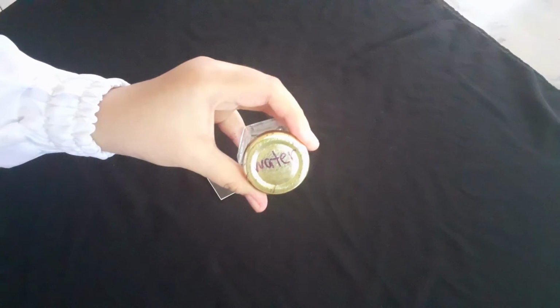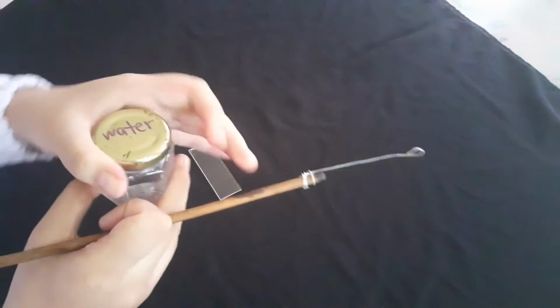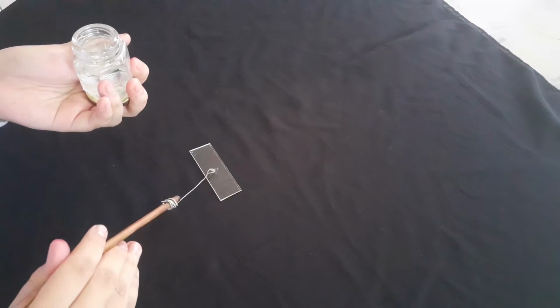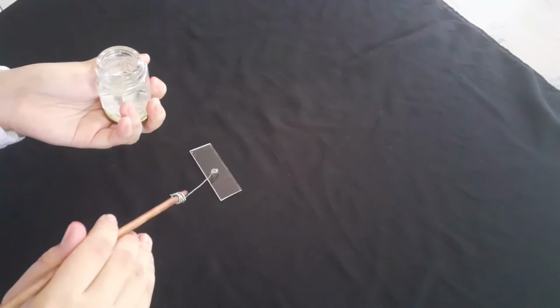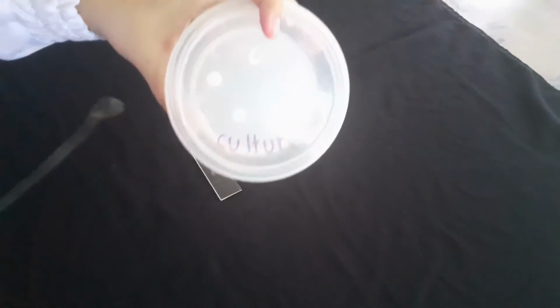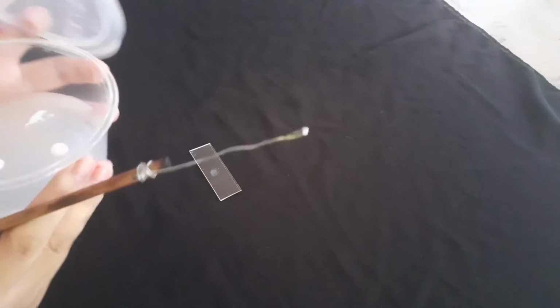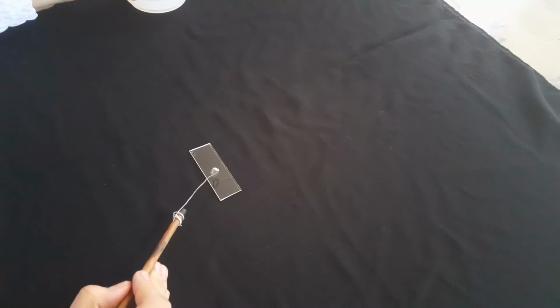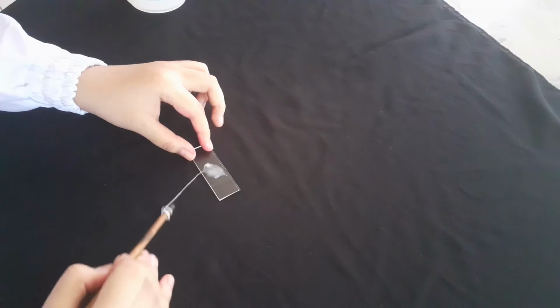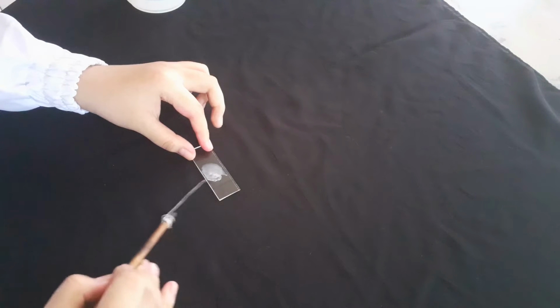Before proceeding with gram staining, a bacterial smear is prepared. For a smear from a solid medium, place 1 to 2 loops of water on the slide. Then, using a sterile loop, touch the entire loop to the culture. Emulsify the cell in the water on the slide. Thinly spread the cell suspension in a circular movement of the loop into an area approximately the size of a dime. This is to avoid the bacterial cells from clumping.